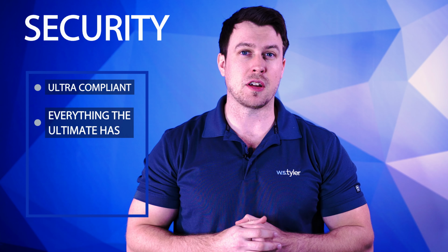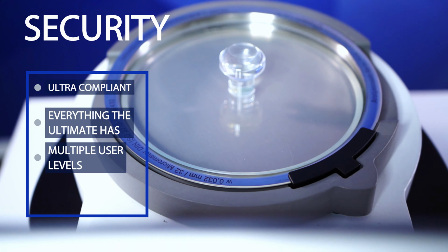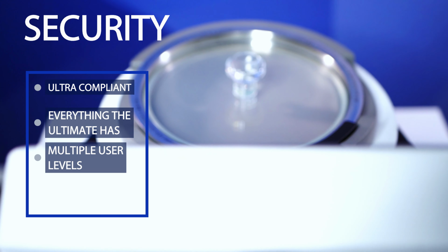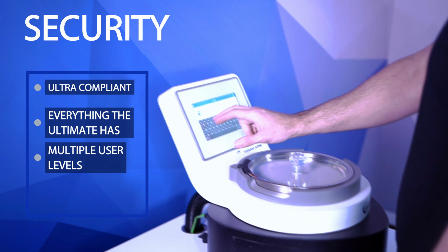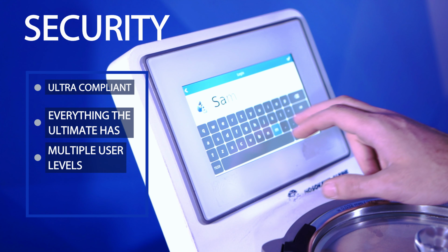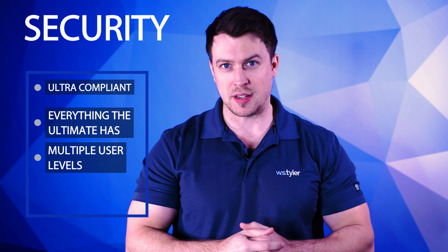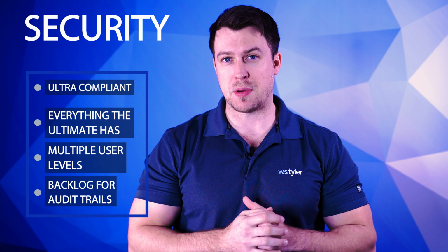The big differences are going to be that it allows you to have multiple different levels of users, so that whoever's running the lab or running the operation is going to be able to create lower tier users who don't have any opportunity to change anything on the instrument, and have to log in and electronically sign every single thing that they do. All of these electronically signed tests and results are going to be audit trailed, backed up onto a network.